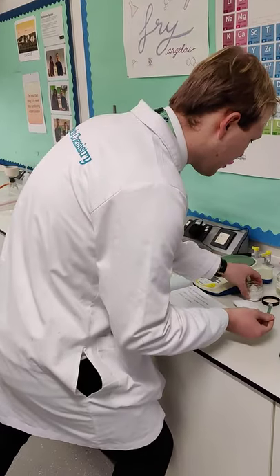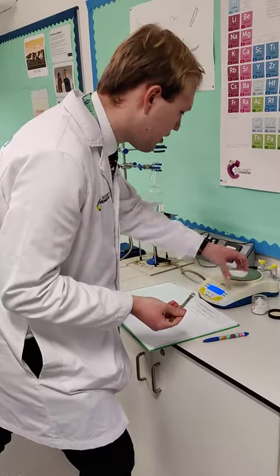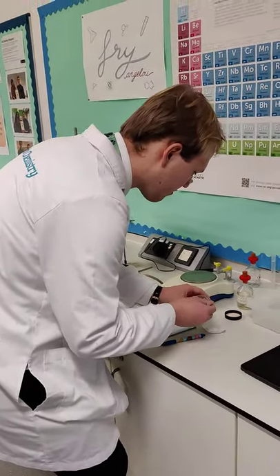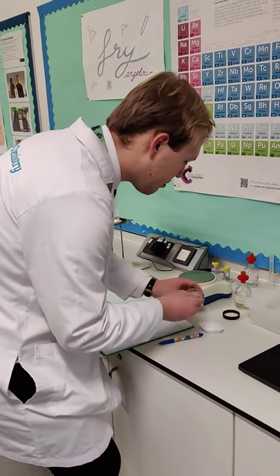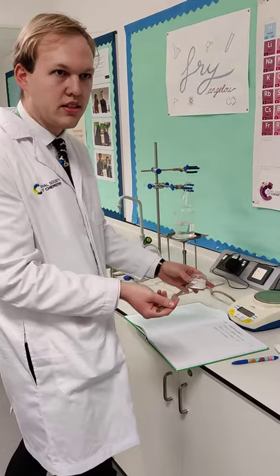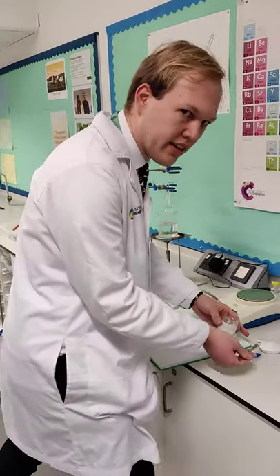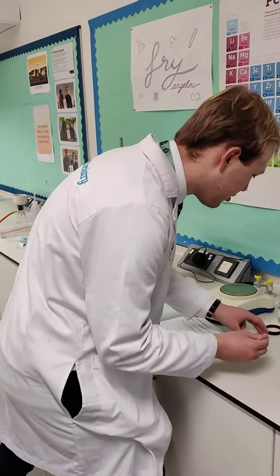Let's have a look at how much we've got so far. We've got 1.75, so still have a good way to go. It's an interesting technique, Mr. Bell. Why are you doing it this way? Well, I like to do this just because it helps with spillage. I don't want to spill any of the salicylic acid onto the mass balance, because that would be mass that's not in this weighing boat and therefore not going to be counted in the actual reaction.